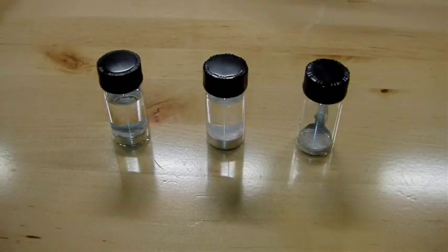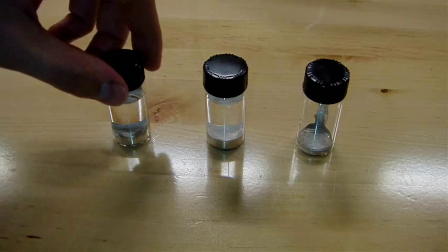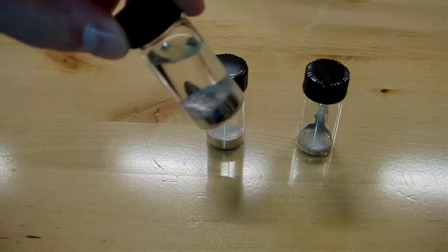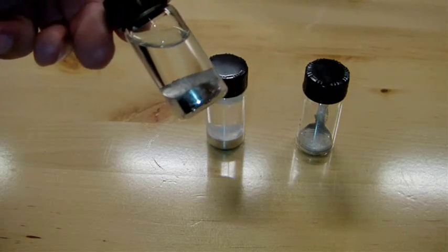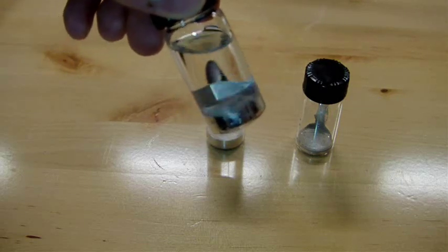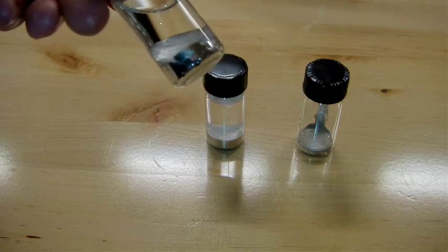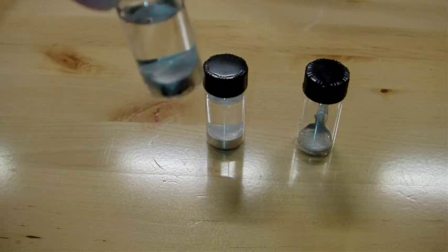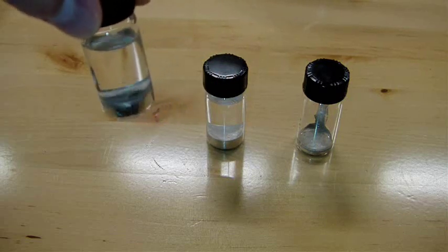Okay, so it's been about a week since I first made these, and let's see how they're holding up. First, the one that was in oil is actually looking quite good. You can see that it's wetting the sides pretty tenaciously. So the level that the metal was at is sticking to the edges of the glass. But other than that, it still looks very silvery. It's still quite liquid as you can see.